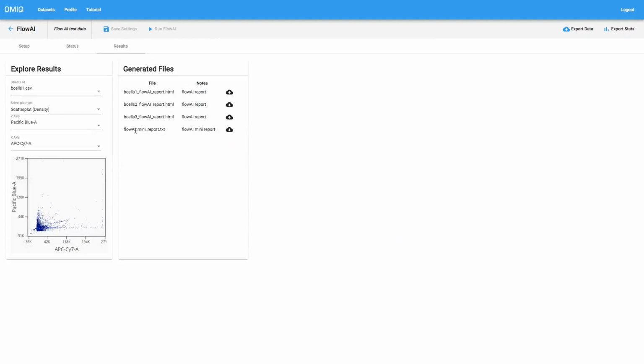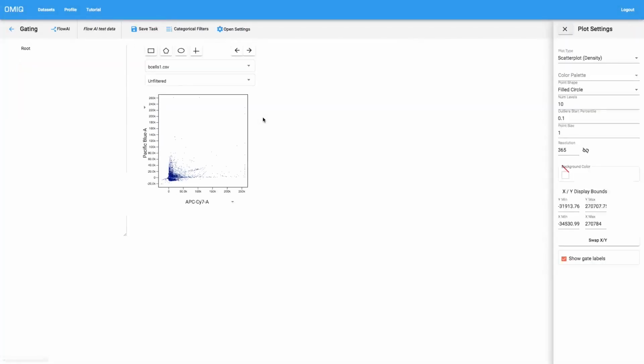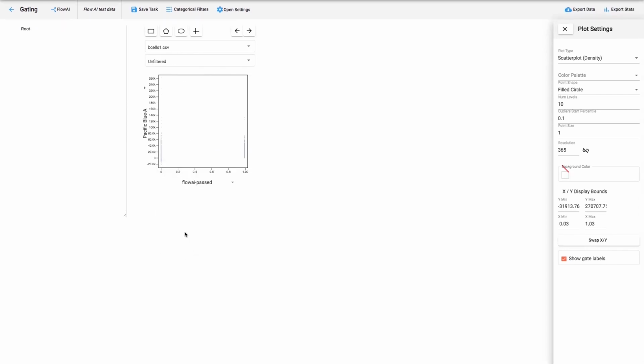The second category of result is the flowai-passed channel, which is added here to the files. And to view that, what we'll actually do is go and create a gating task after the flowai task. So you can see that it goes flowai and then gating. And if we look at that parameter, flowai-passed, we'll see that there's two values. And we can look at the values encoded as any sort of plot. And one of the values is 0 and the other value is 1. And what 0 means is that flowai decided that these data points should be rejected. And what 1 means is that flowai determined that these data points would pass the analysis.